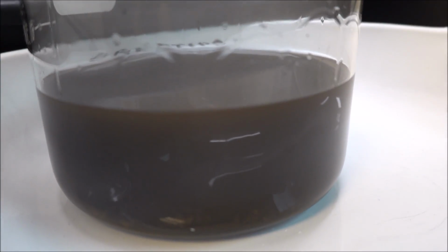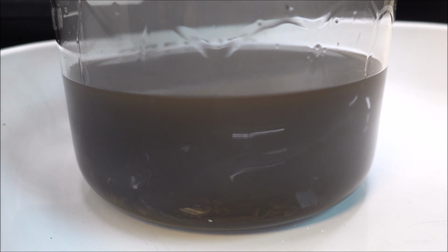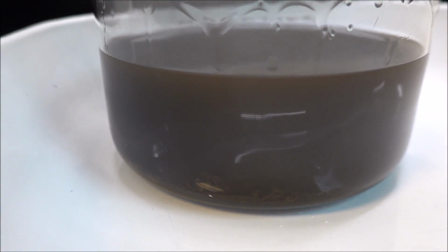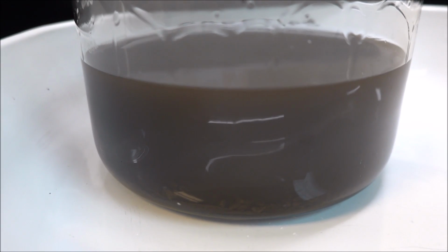Alright, I'm trying to get a shot of the color of this liquid. It's got a pale purple color to it, which tells me that there may be some colloidal gold suspended in the solution.